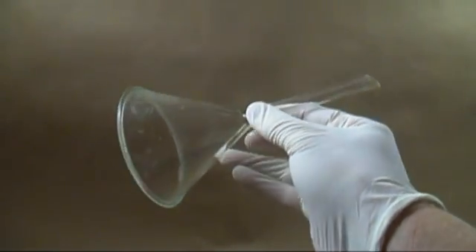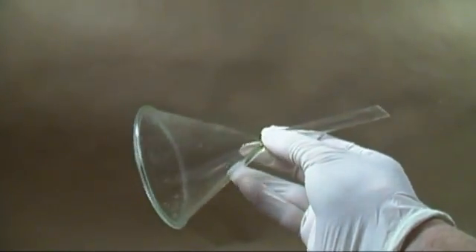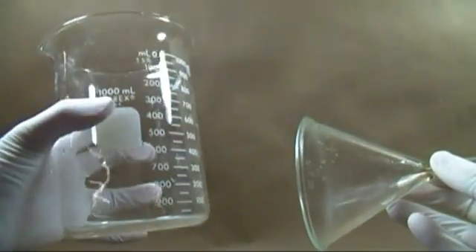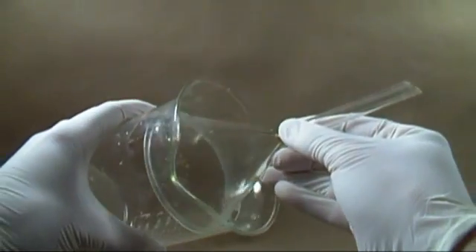The first thing you'll need to perform this task is a funnel. I'm using a glass one so you can see how this works, but any funnel will do. You'll also need a beaker that the funnel can fit in with a small amount of room free around the sides.